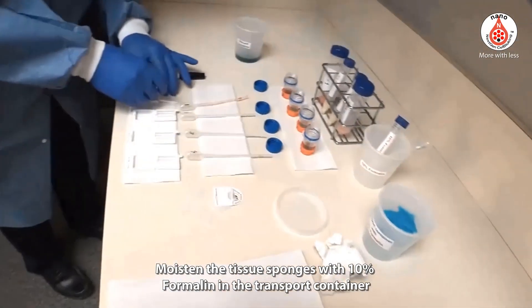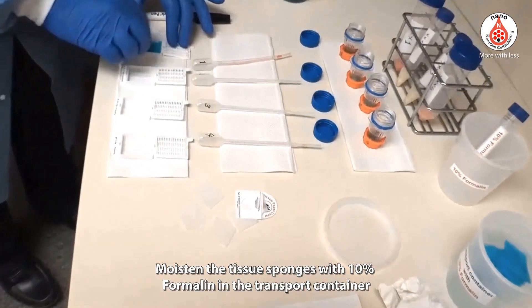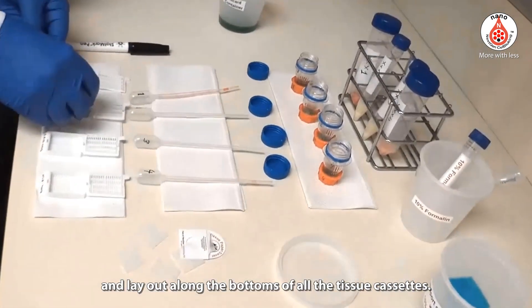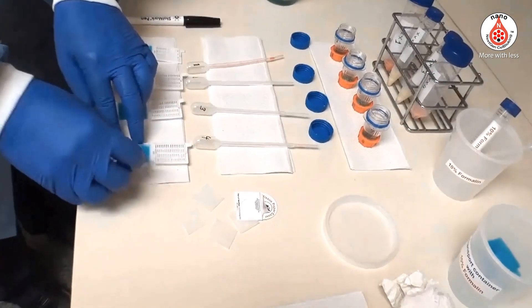Moisten the tissue sponges with 10% formalin in the transport container and lay them out along the bottoms of all the tissue cassettes.